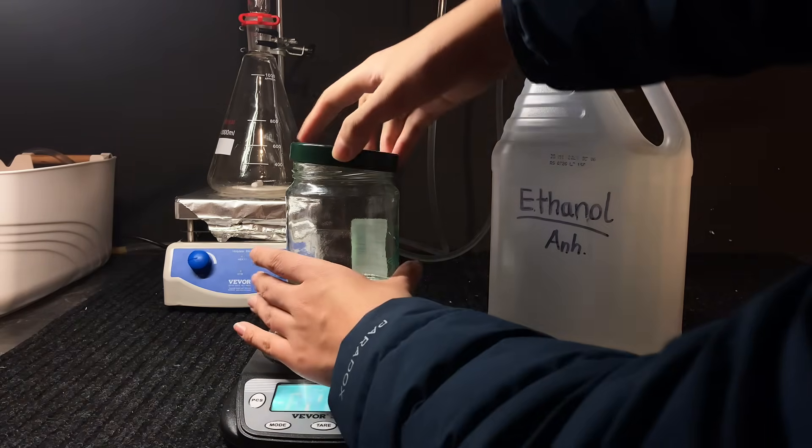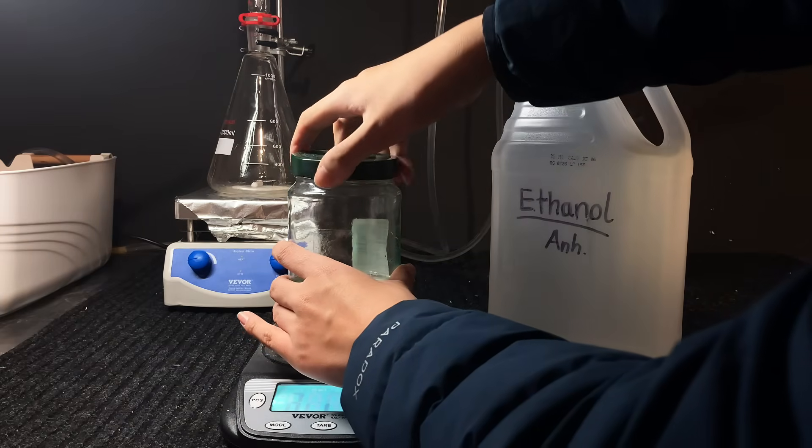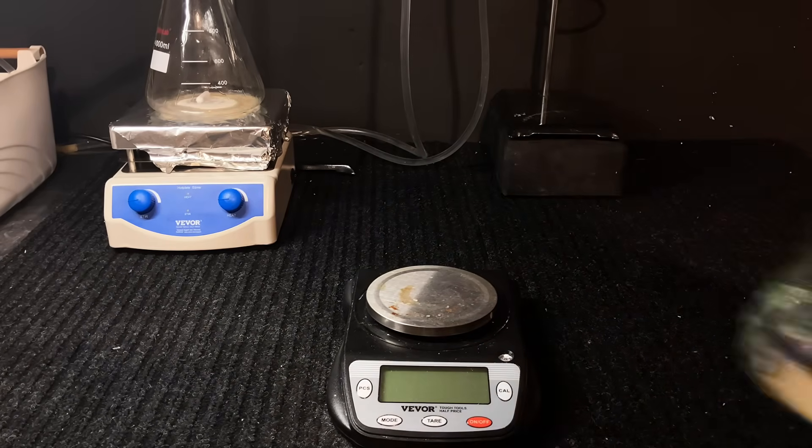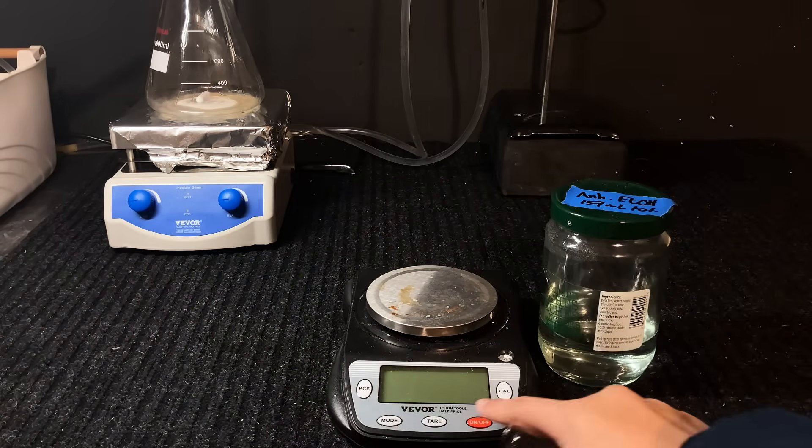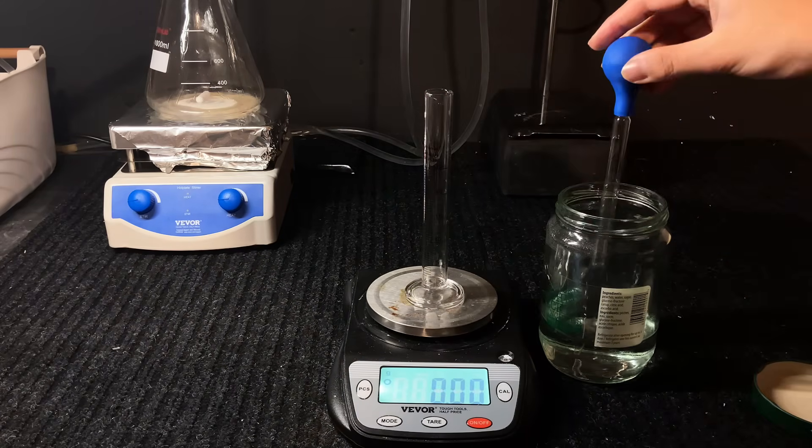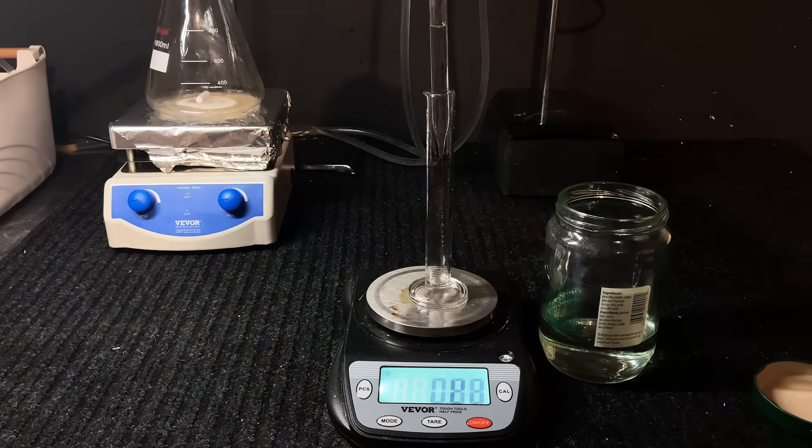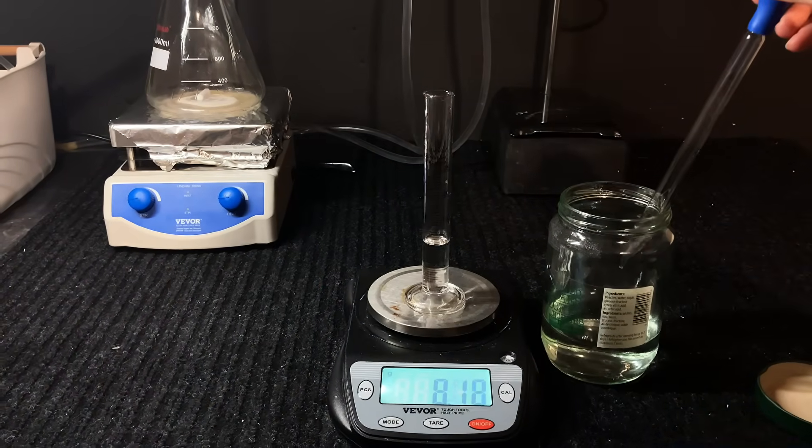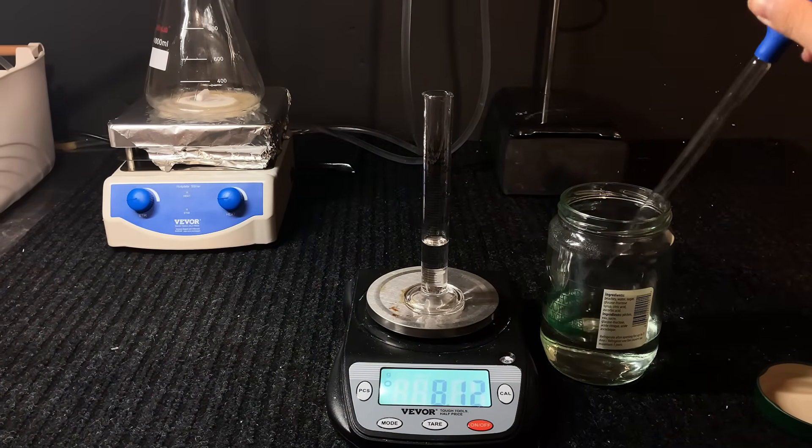Now it's time to just conduct an evaluation of the product. I didn't have an alcohol hydrometer, so I decided to just go with roughly calculating the density with a graduated cylinder, and you can see how it is extremely close to the theoretical density at that temperature, and it's at least 99.5% pure. After all, there is still some uncertainty in my measuring tool, so as far as I know, it may be even purer.